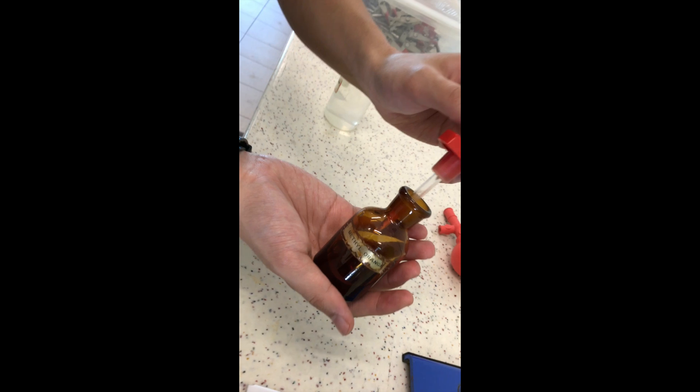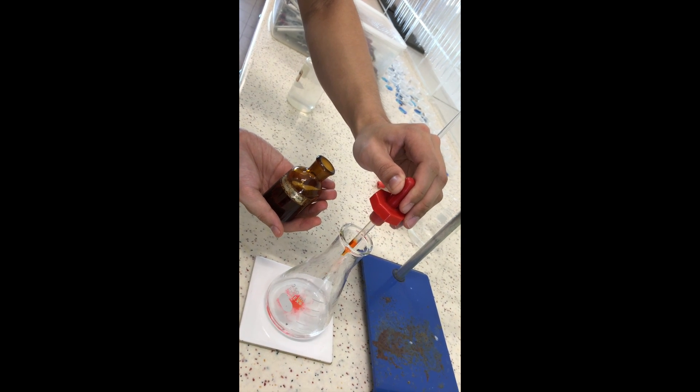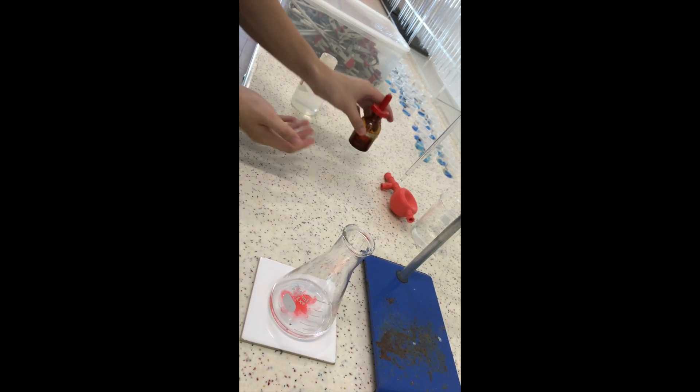We are now ready to add an indicator to our solution. Just 2 or 3 drops is enough. Swirl to mix well.